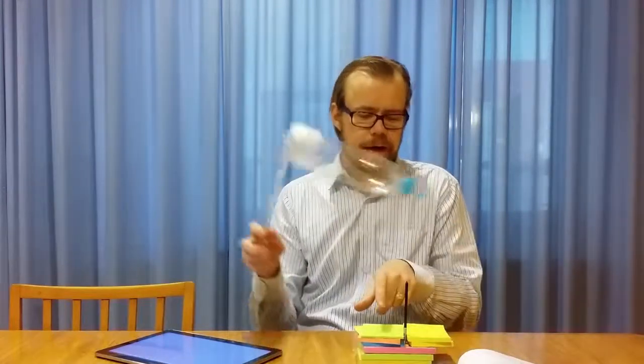Like this. I have a very sharp thing on the substrate, and then I have my very big tip. And then I come here and start scanning. Then you see when the tip comes close here, it goes over here. And what actually is happening here is that it follows the contour of the tip, right? You see?